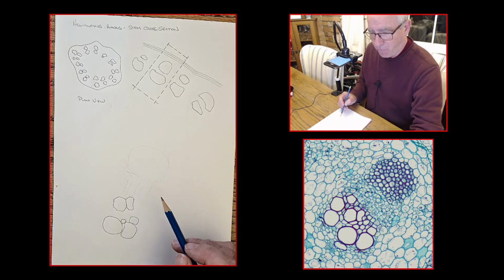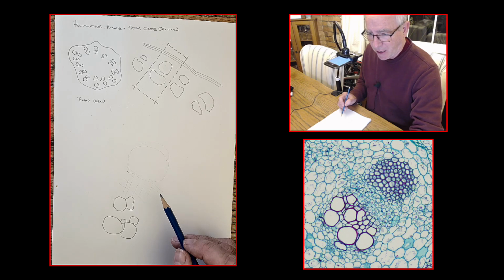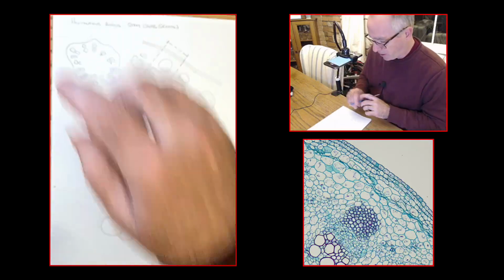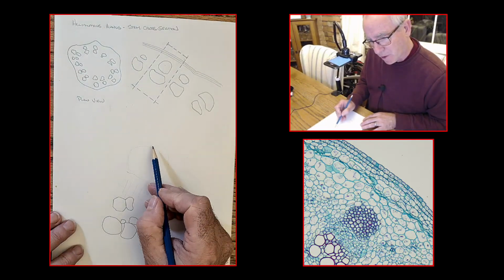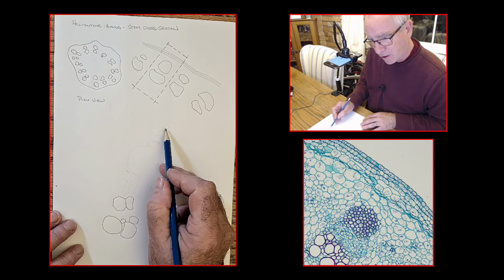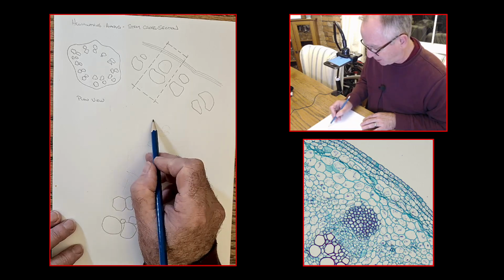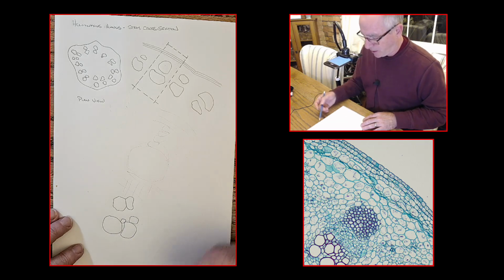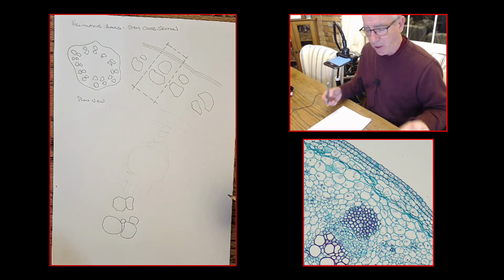If you look further to the outside of the cell, sorry, bear with me. I'm just trying to figure out how to move the image around on my computer here. There we go. Okay. There's a 1, 2, 3, 4 biggish cells that are going to go here. And then there are those few layers of smaller square cells. So you see what I did? I did a real quick sketchy guide to where all of the different cell types are going to be.